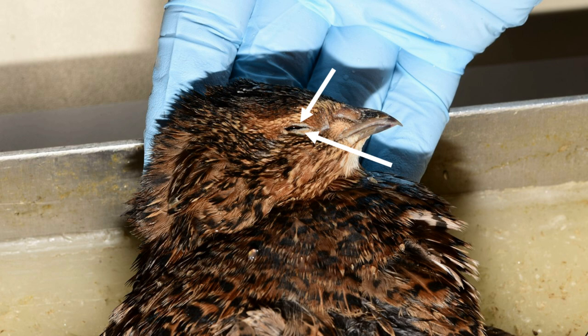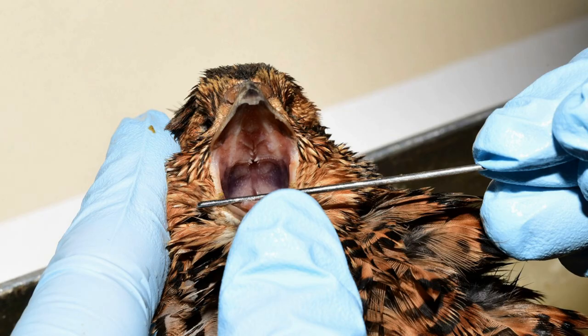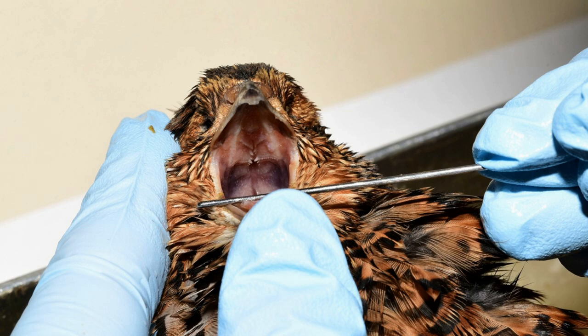The ear canal is generally hidden. A look into the beak is also worthwhile — all recent birds lack teeth. The tongue is usually narrow and hard, and most birds have fairly poor smell and taste. The palate, choanae, tongue, and glottis can be seen in the oral cavity.